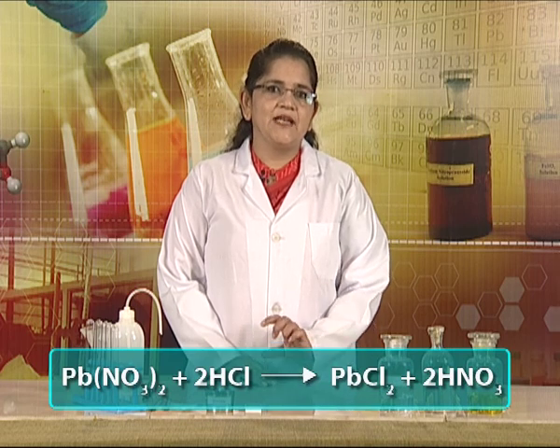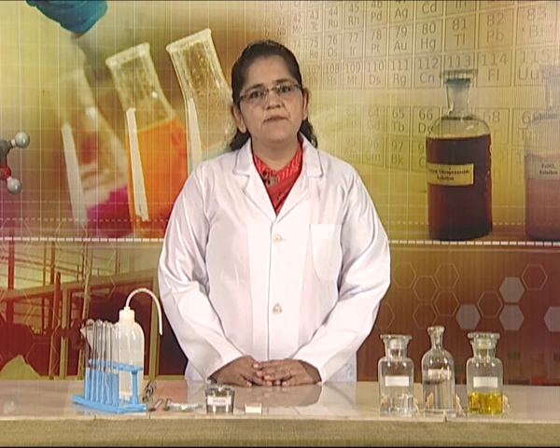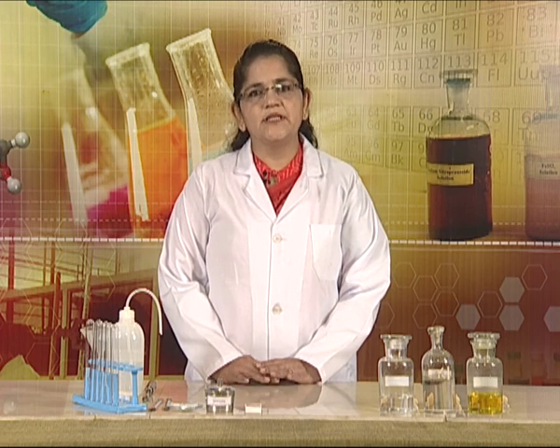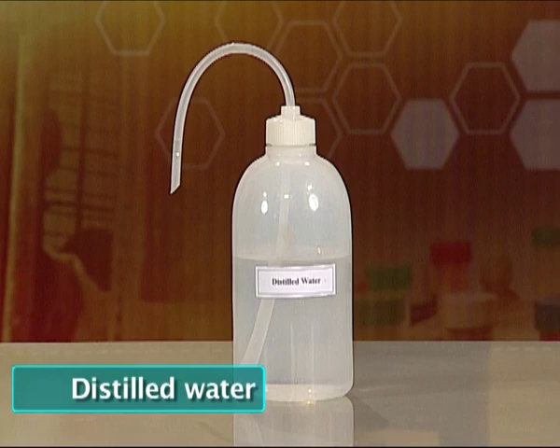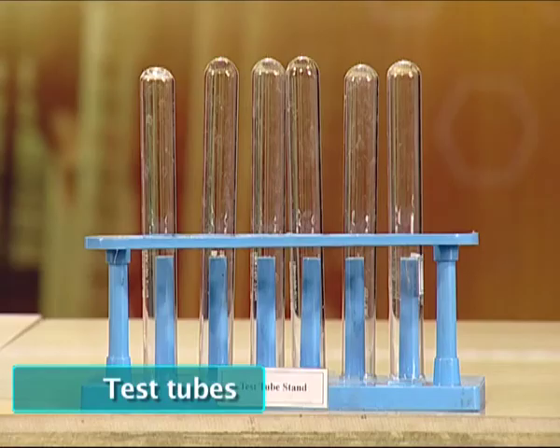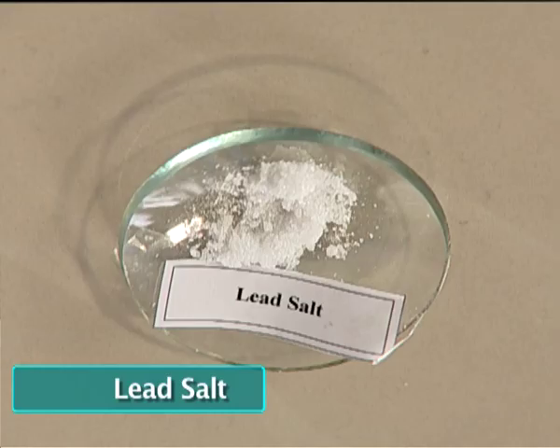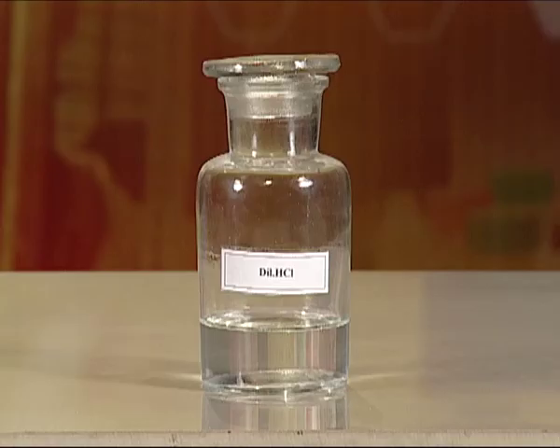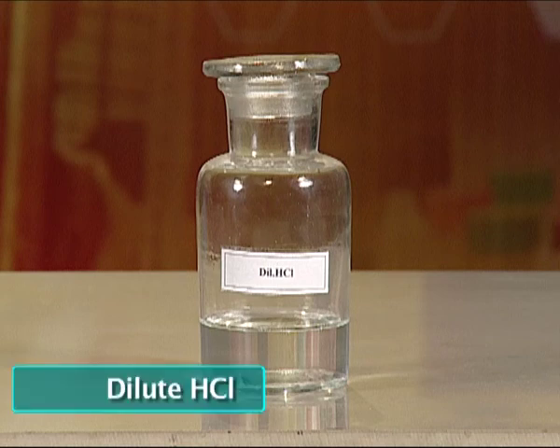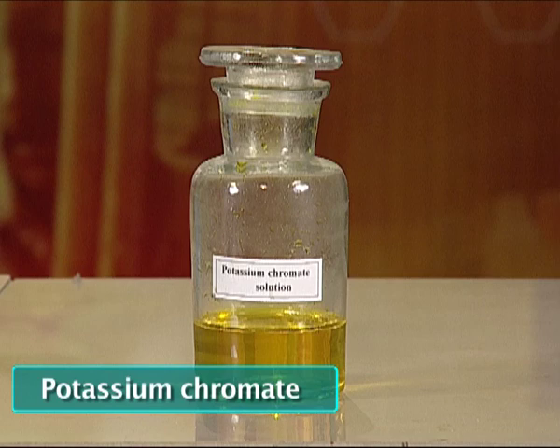You can see that lead chloride is the white precipitate which is formed. The materials required for this experiment are distilled water, funnel, test tubes, test tube stand, spatula, salt, spirit lamp, and test tube holder. The chemicals required are dilute HCl, potassium iodide, and potassium chromate solution.